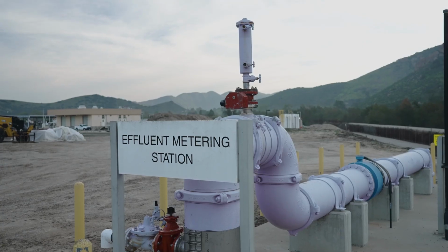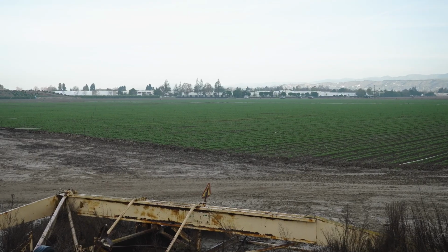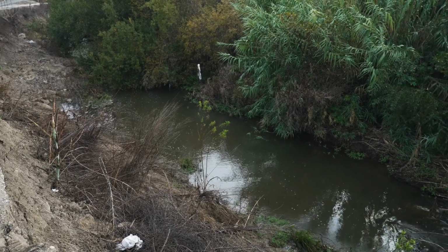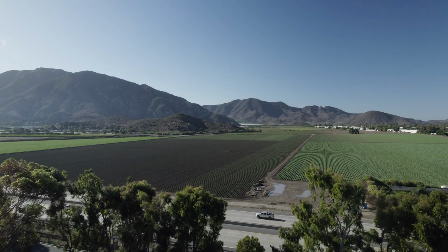It's very important to ensure all of the parameters of the water leaving are up to standard, since this water then either goes on to irrigate landscaping and food crops or is discharged into the watershed. So Eric, what other samples do we analyze other than recycled water? We also do a lot of analyses on the creek water, both upstream and downstream of the treatment plant, to ensure that we aren't negatively impacting the environment.